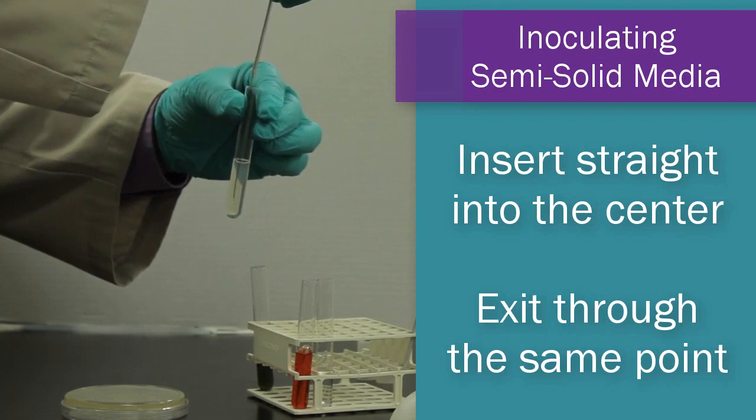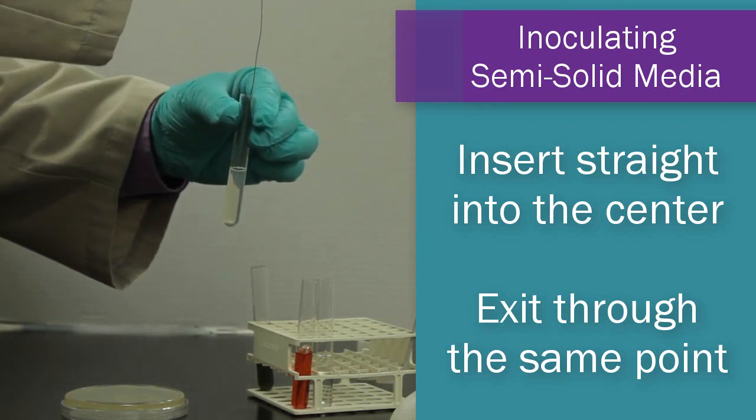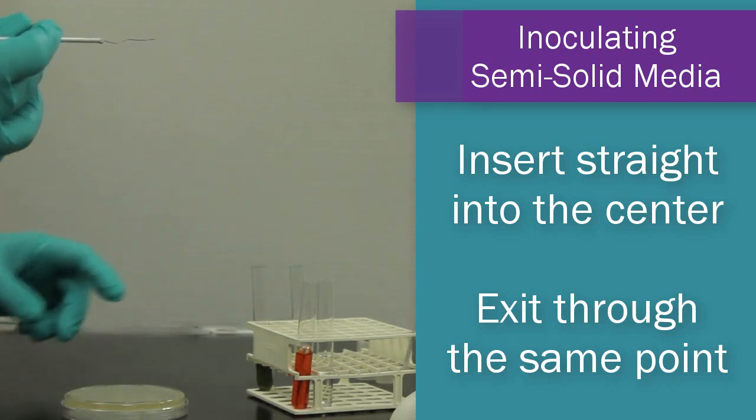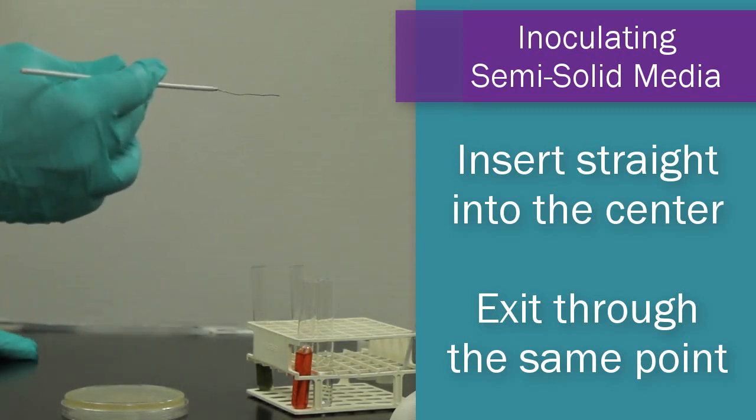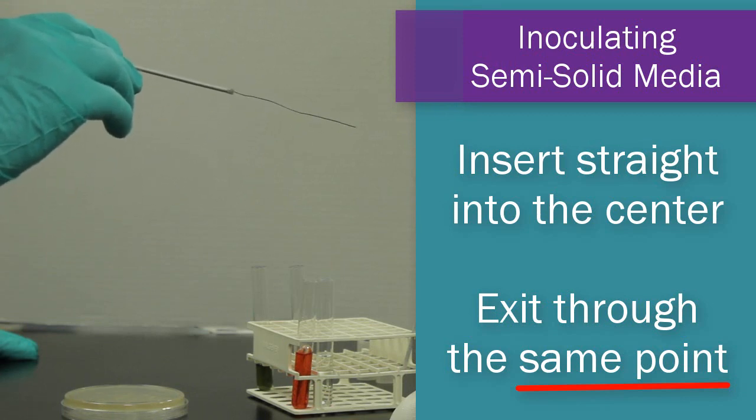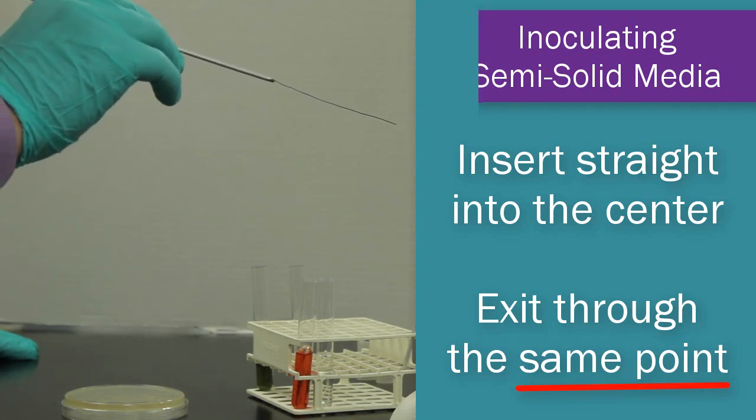When you feel it touch the base, come straight back out the insertion point. In this case, guys, it's very important that you insert and extrude through the exact same point that you used. You don't want to disturb the semi-solid media as little as possible. That's the only disturbance you want.